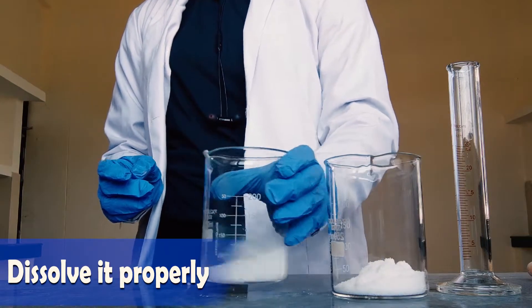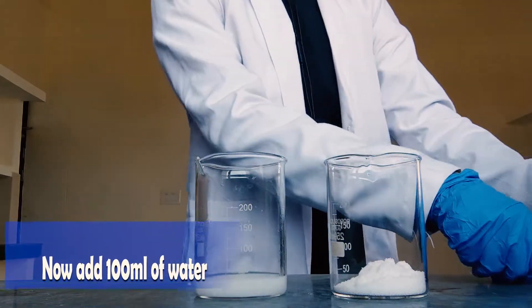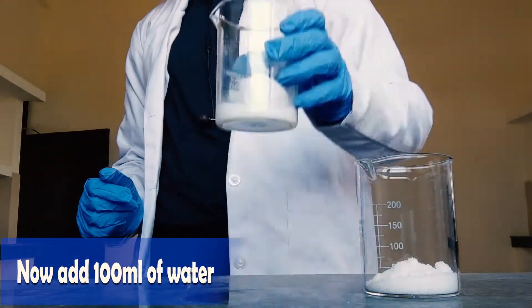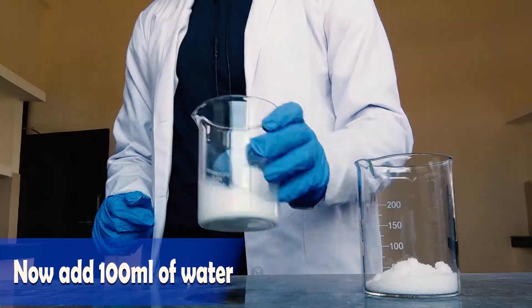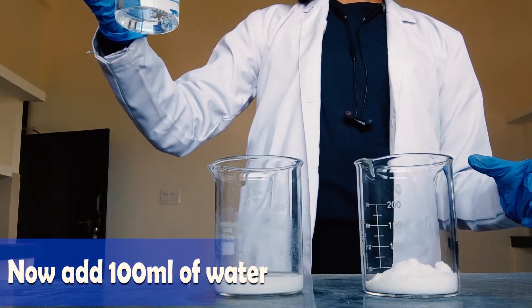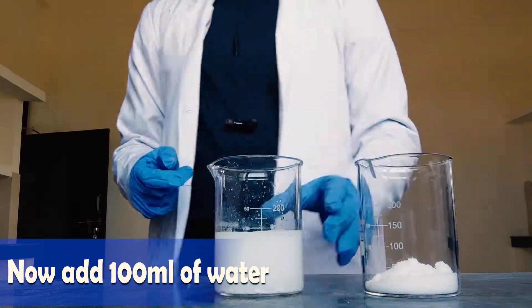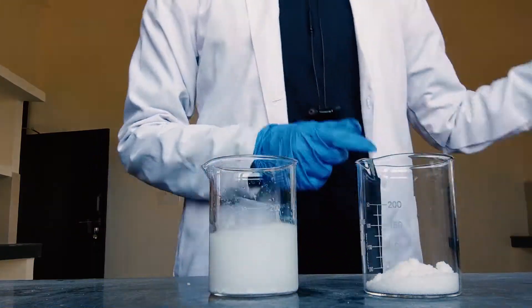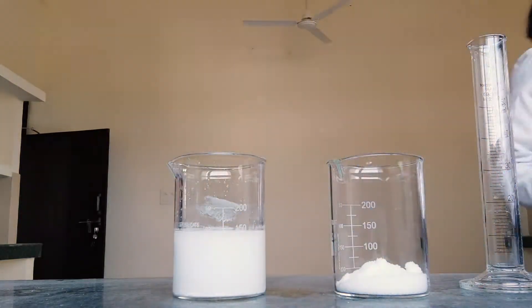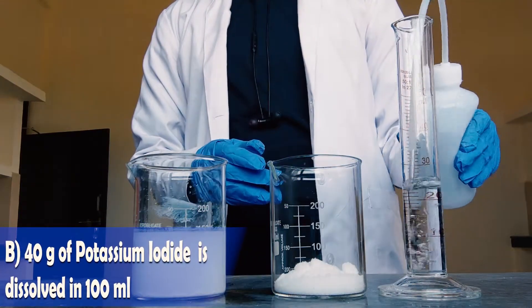Now in the second beaker there is 40 grams of potassium iodide. In the 2 grams of bismuth sub nitrate, which is already dissolved in glacial acetic acid, you have to add 100 ml of water. Now dissolve the liquid very properly. The first beaker has 2 grams of bismuth sub nitrate, 25 ml of glacial acetic acid, and 100 ml of water — this is our solution A.